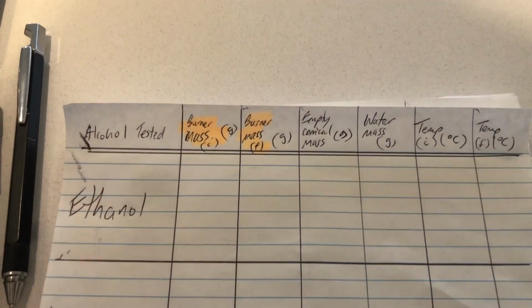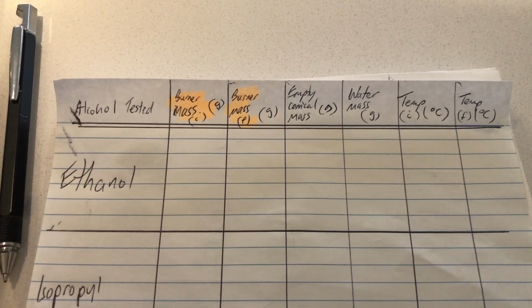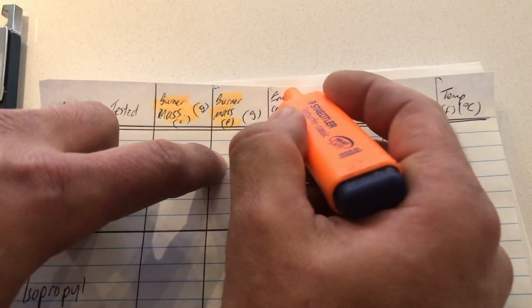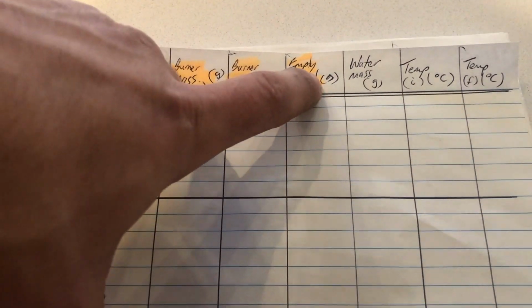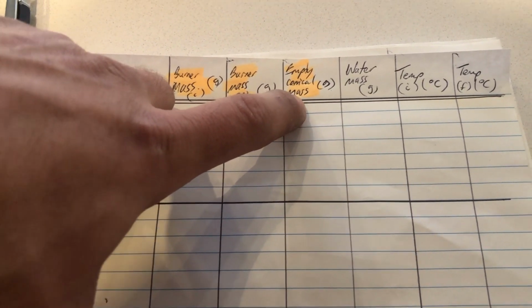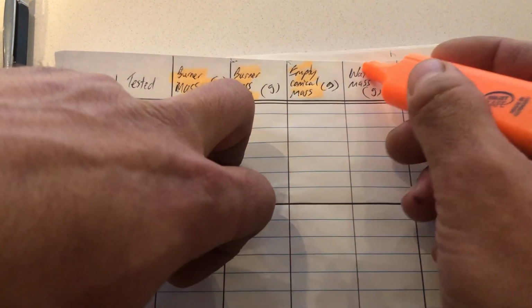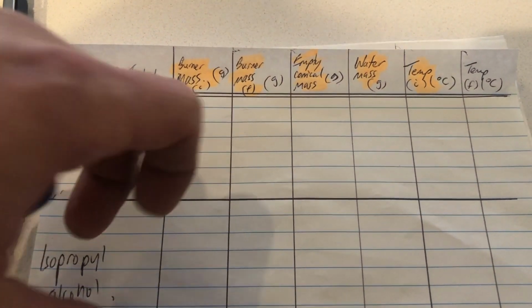All right, so some of the raw data that you'll need to get there, I want us to get the most valid result possible. So we're going to take into account every bit of energy that we believe the reaction gave off. So we're going to look at how much the glass conical flask weighs in grams in order to work out the exact amount of energy that goes into the glass. We're going to assume that it has the same initial temperature as the water, and we'll track how much water was inside the conical flask, and that will be in grams as well.